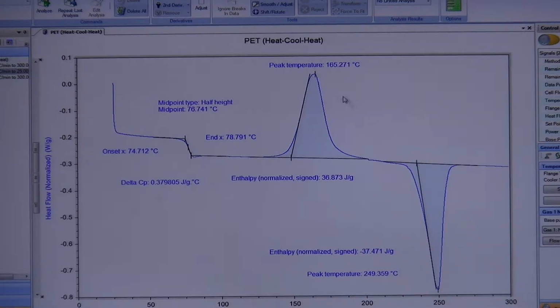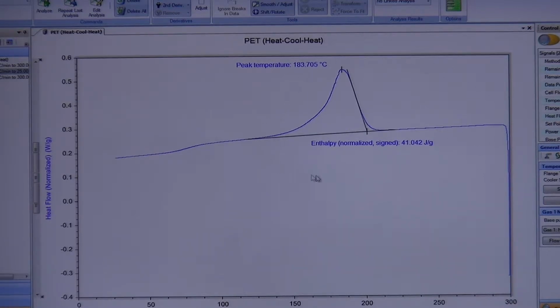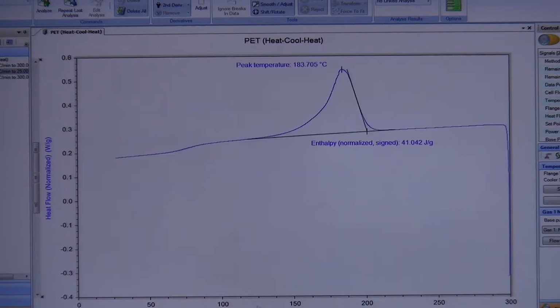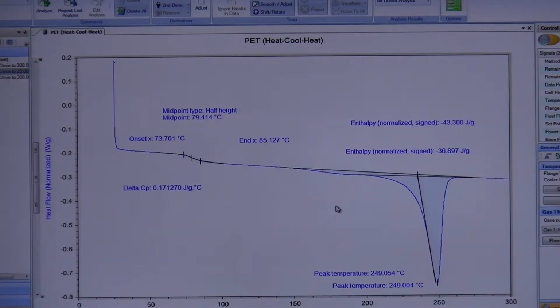Okay? Now remember, this first heating is dependent on what the original sample looked like. Now that I got to 300, I no longer have that original sample. Remember that first heat erases your thermal history. So now whatever this shouldn't happen again. Okay? Now my cooling scan, that is going to determine what I then see in my second heating. So that's why I measured this one really quickly, because you can see that this enthalpy is now 41, which is closer to the 43 that I just measured. Okay? So you can see that the cooling scan imparted its own history to the material that you can then read back in the subsequent heating. So that's why it looks different, and that's why the numbers are different. Because you're imparting something completely different than the original material came in.